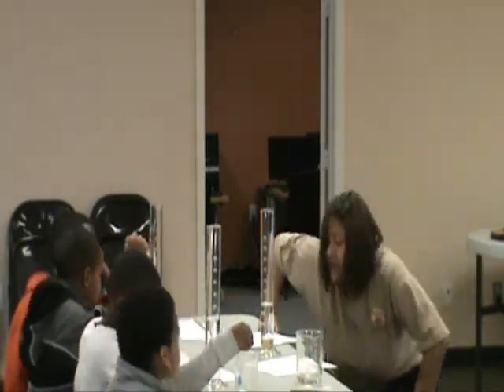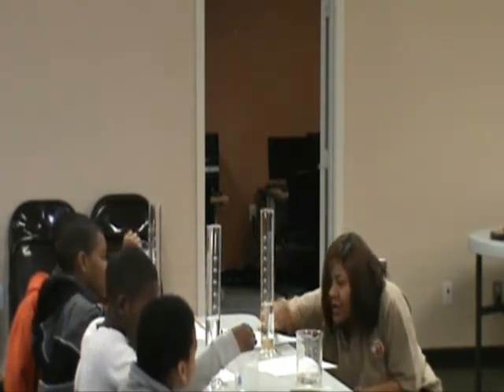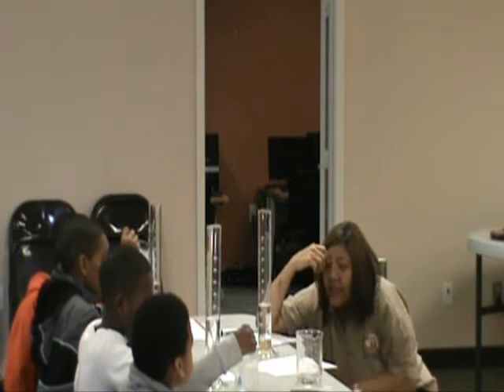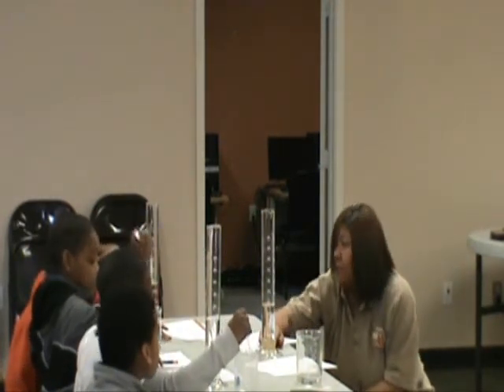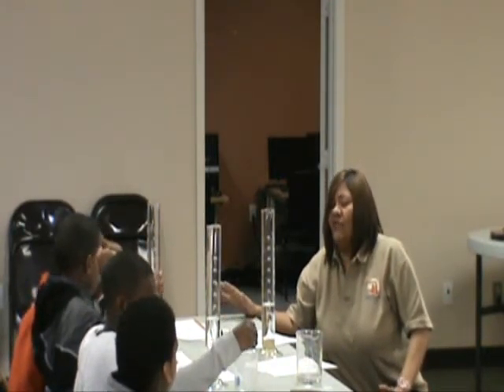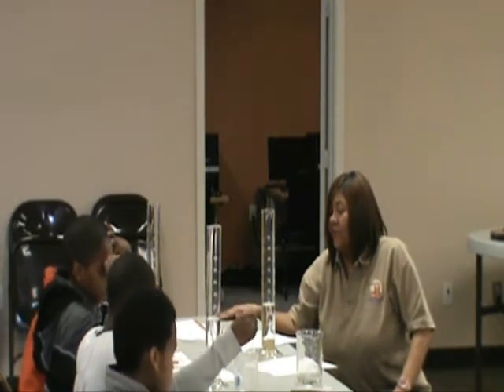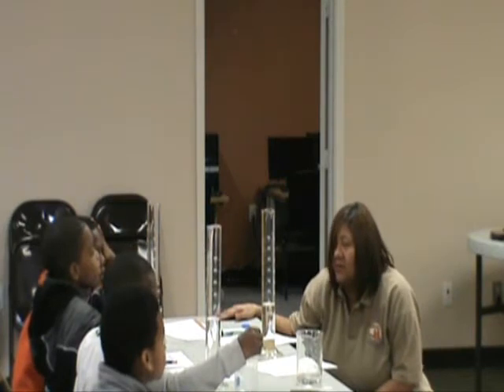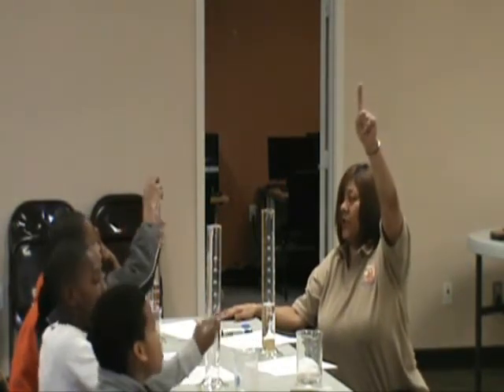And then, we know that the initial volume was 250. Then you come to the eye level, and you look at the bottom. What is your initial volume? Everybody, what is your initial volume? 250. Look on line 5. 250 what? 250 Ninja Turtles? No. 250 what? Milliliters.